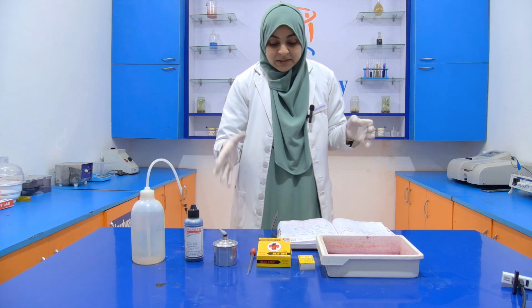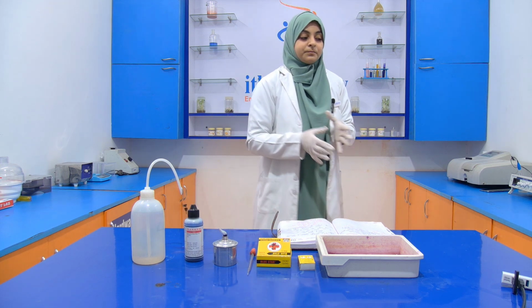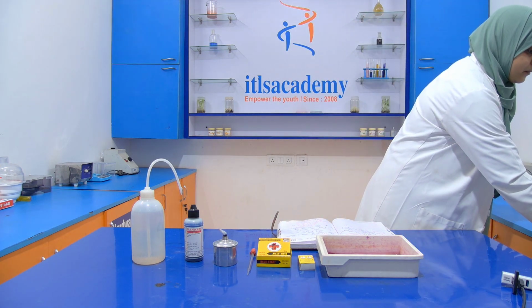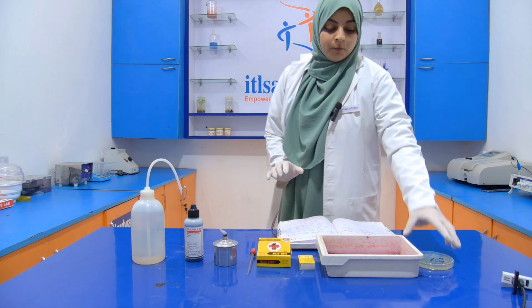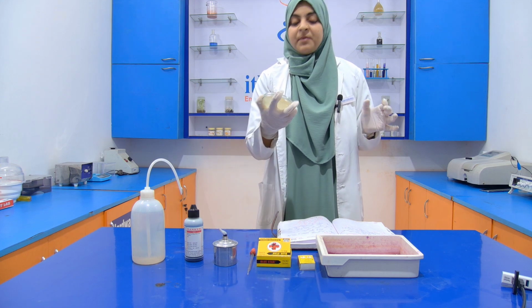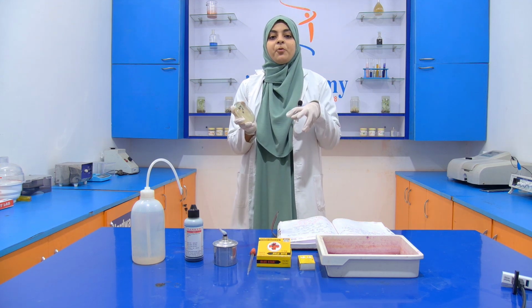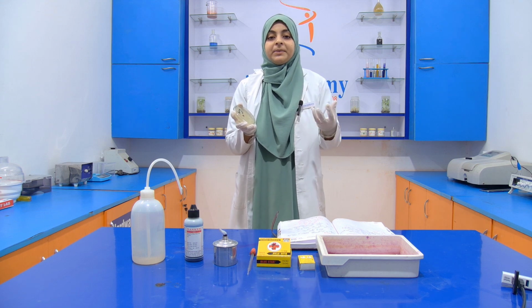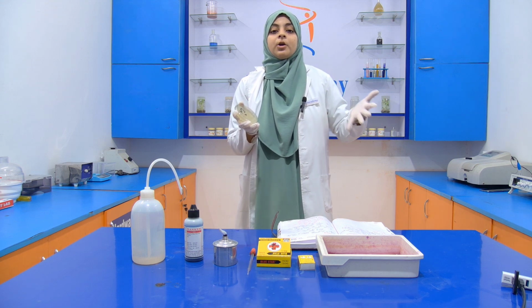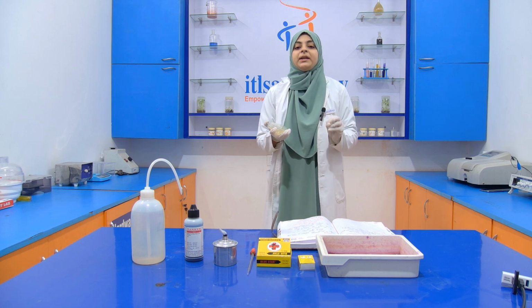Now, what is the procedure? We already have a culture, which we prepared with the help of the pouring method. How we do the pouring, how we prepare the media, and how we do a serial dilution, the videos related to this are already uploaded on our YouTube channel.